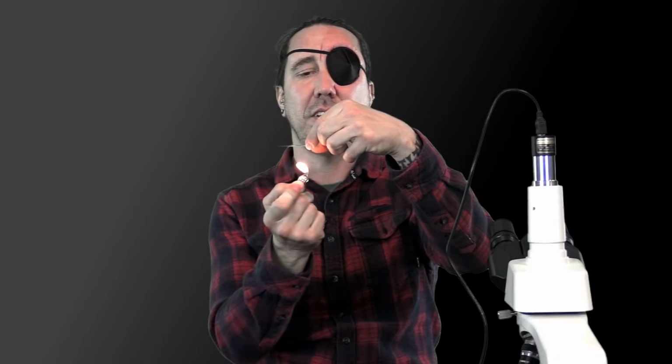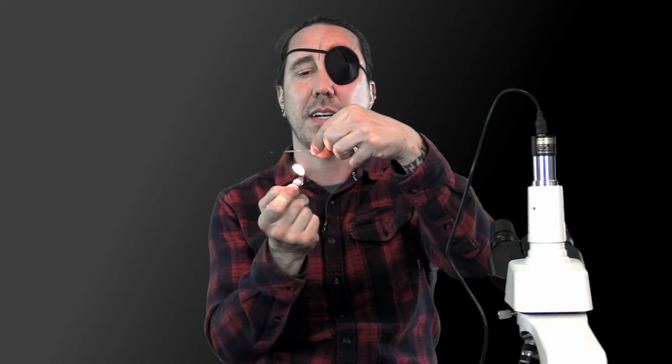And then I'll put it underneath there. And let's say that the nematode has gone from moving like this to just moving slowly, but I still can't definitely see its head. I want to pop that back out, and I'll do it one more time. I've had to do this up to 4 or 5 times because those little suckers don't want to die or don't want to stop moving.